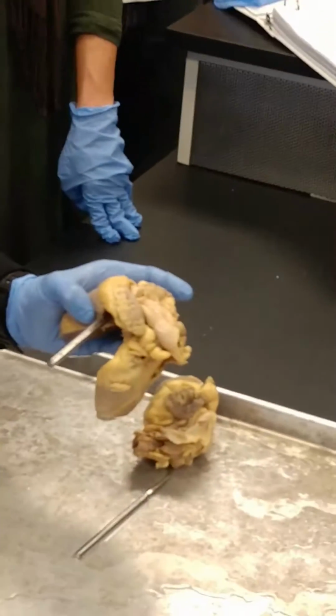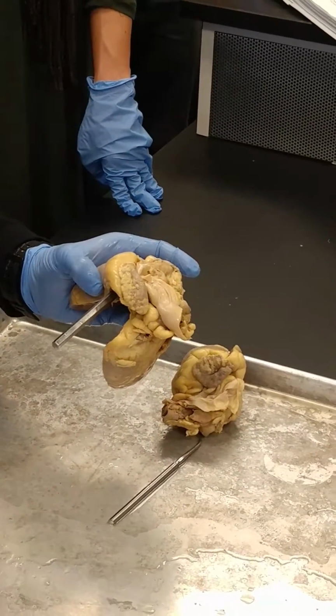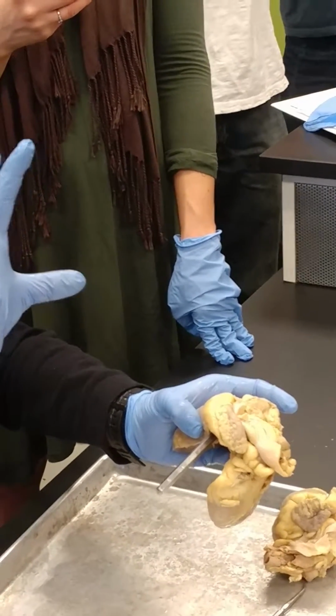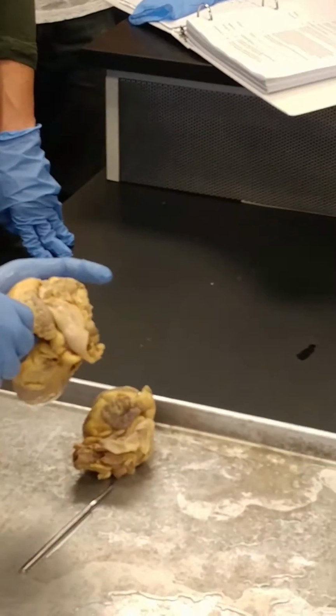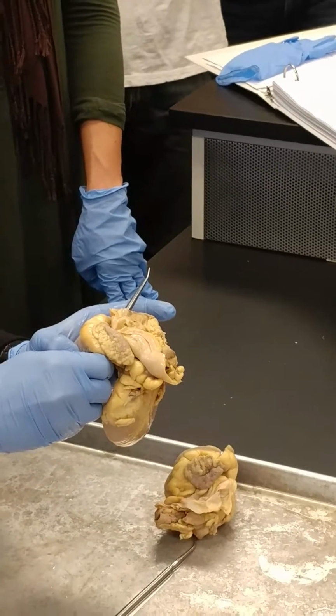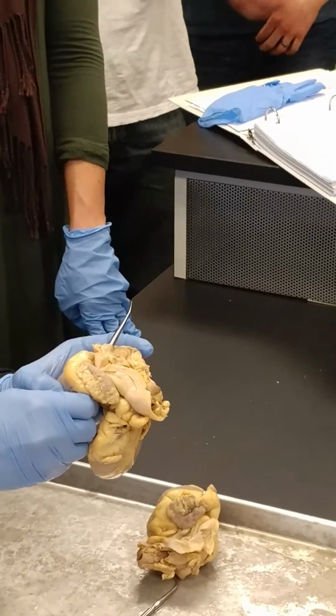Well, if I had a trumpet, all of the tube would be the cardiac veins, and where it flares open, where all the air comes out, that big open flare would be the coronary sinus. Okay? So then that there is the great cardiac vein going into the coronary sinus, and all I have to do is just go straight up, pull out, go straight up, and now I'm in the superior vena cava.